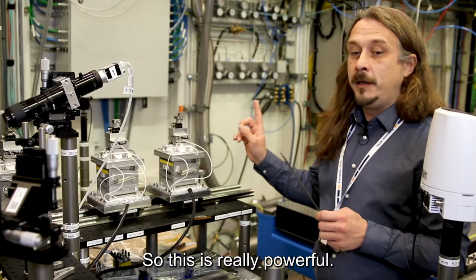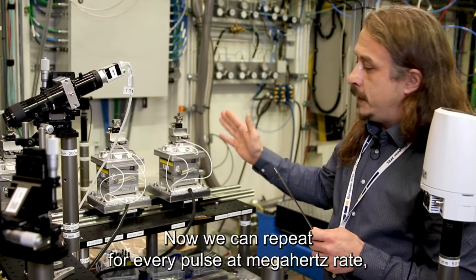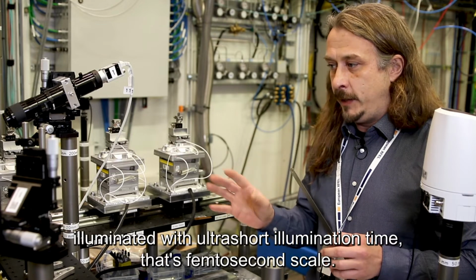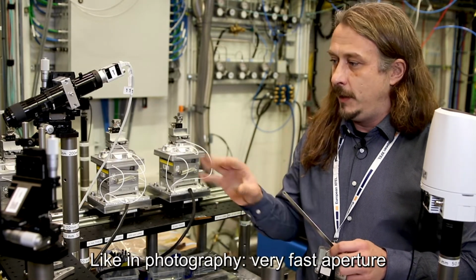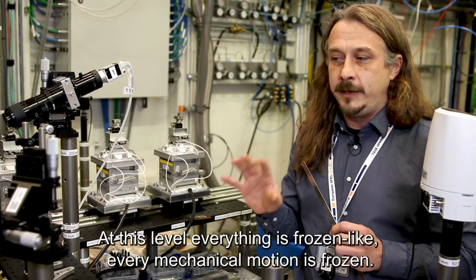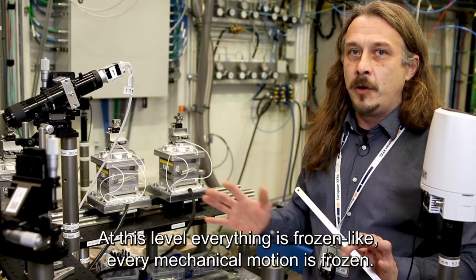So this is really powerful. Now we can repeat for every pulse at megahertz rate, so 1,000,000 and more pictures. And for every picture, we get a 3D snapshot illuminated with ultra short illumination time. That's a femtosecond scale, like in photography, a very fast aperture, but in this case at femtosecond scale. So at this level, everything is frozen. Every mechanical motion is frozen.